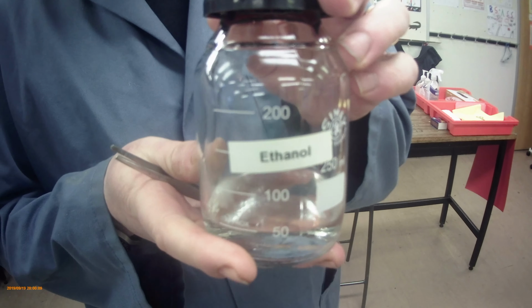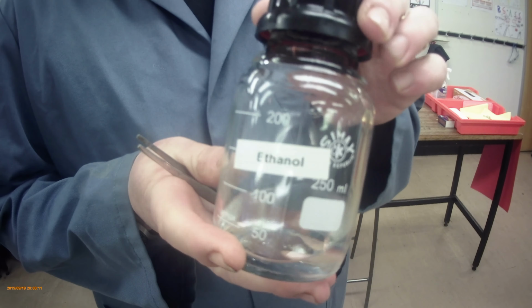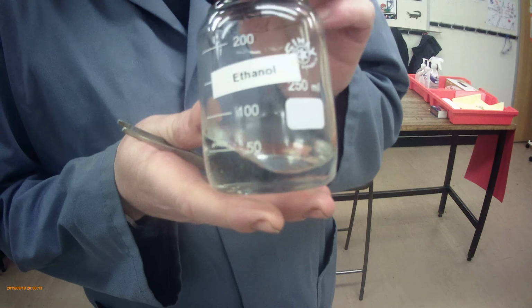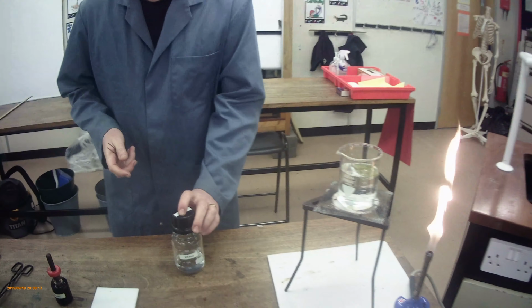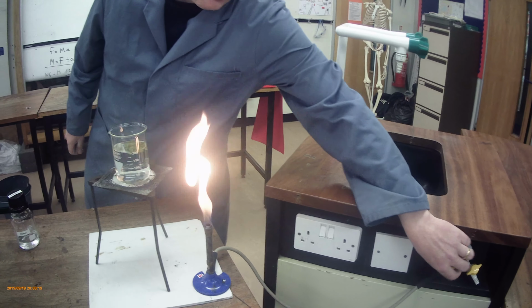And ethanol, very, very useful thing in the lab. We keep this one in the fridge so it's nice and cold. Look at that. Proper ice on that one, so it's lovely and cold. The problem with ethanol, apart from people who want to drink it, is that it's incredibly flammable. So the biggest safety thing that we do here is we're going to turn the Bunsen burner off so that there are no flames around.